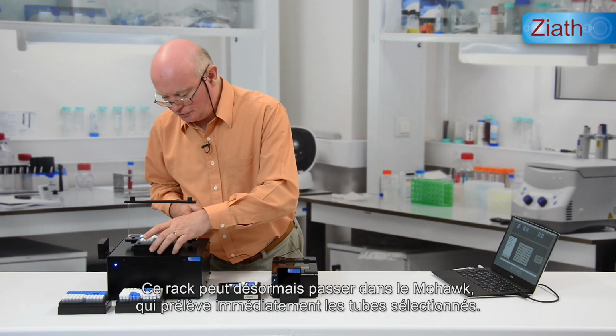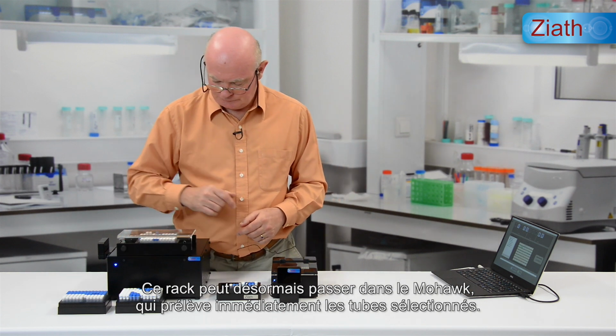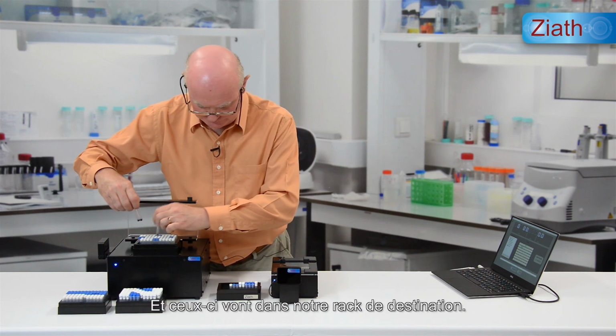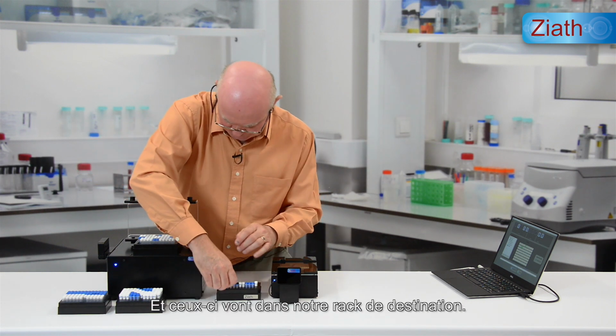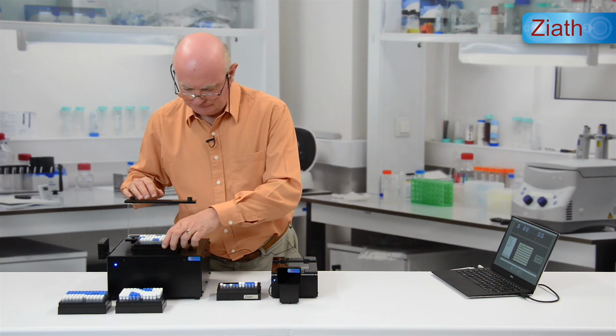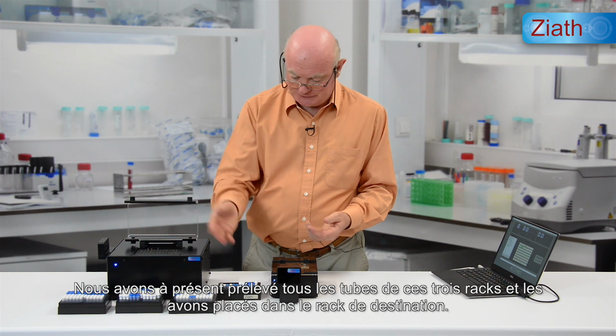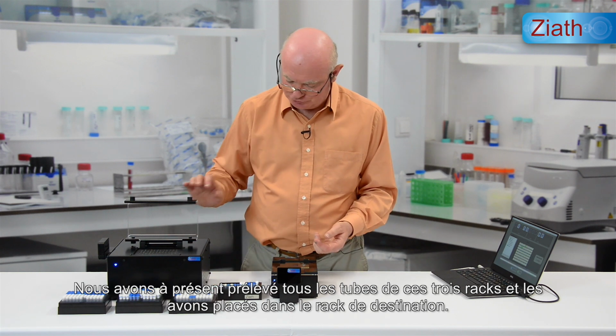That rack goes to the Mohawk. It immediately picks the selected tubes, which go into our destination rack. So now we've selected all of the tubes from these 3 racks and placed them in a destination rack.